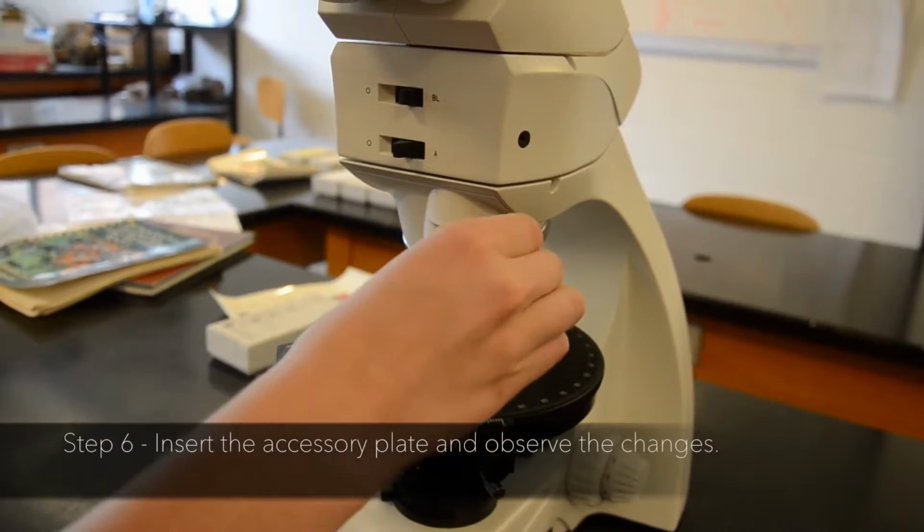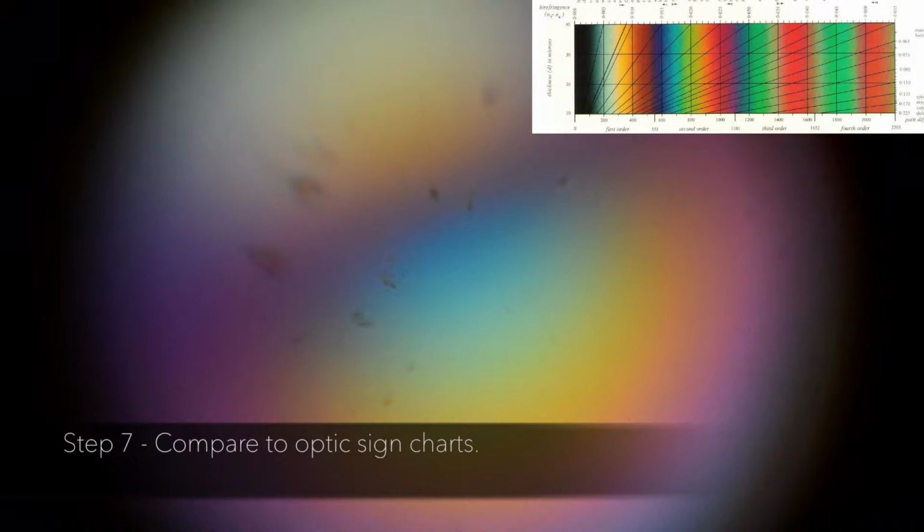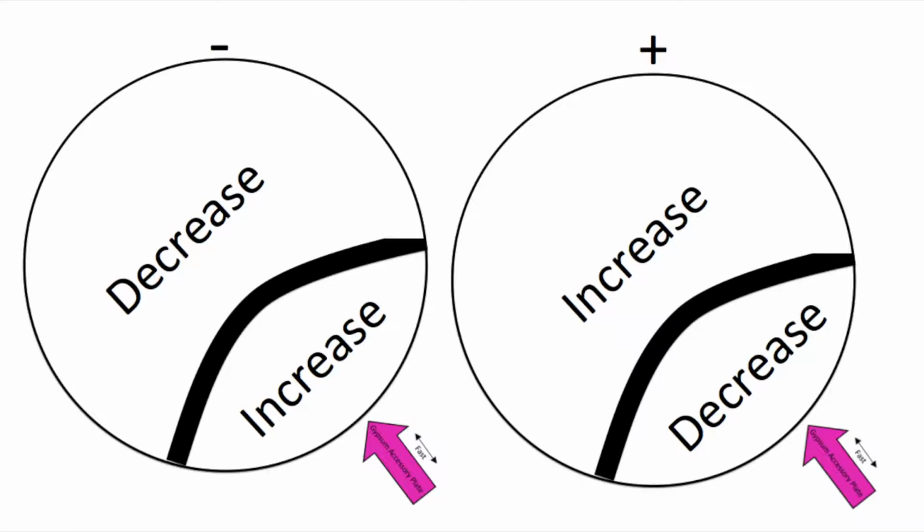Step 6. Insert the accessory plate and observe the changes. Here, our example shows an increase in retardation inside the curve of the isogyre and a decrease in retardation outside the curve of the isogyre. Step 7. Compare to optic sign charts.